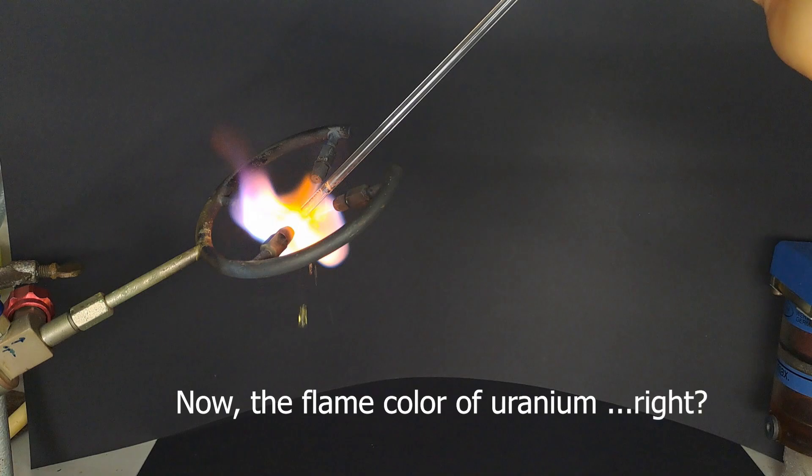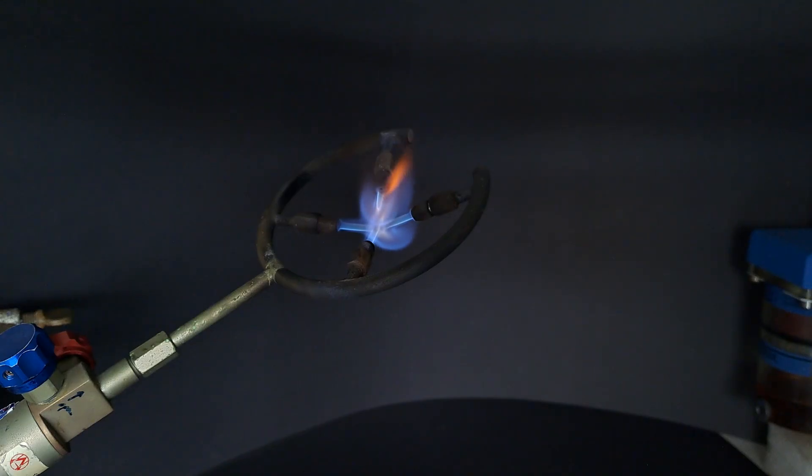Or is it? Let's be sure as this would be a very cool discovery, and to avoid anything that could influence the flame color, let's use a platinum wire, the ultimate material when it comes to purity.